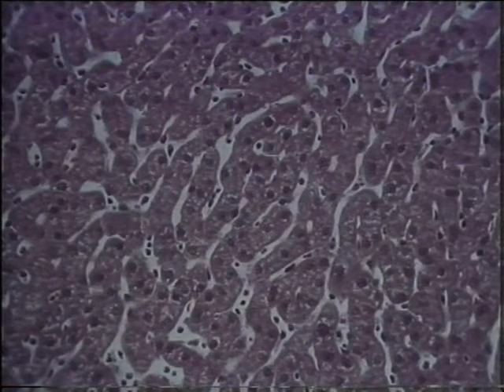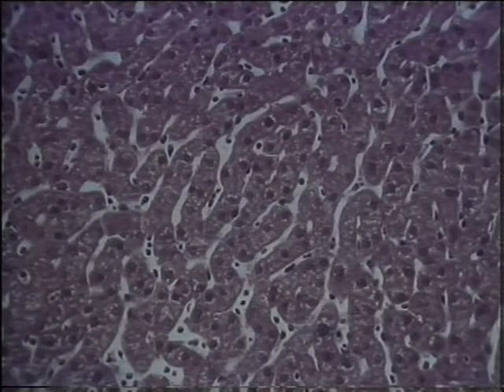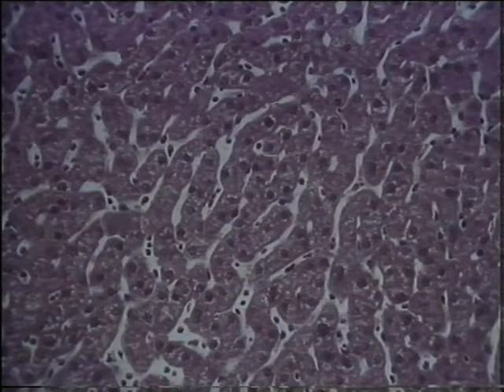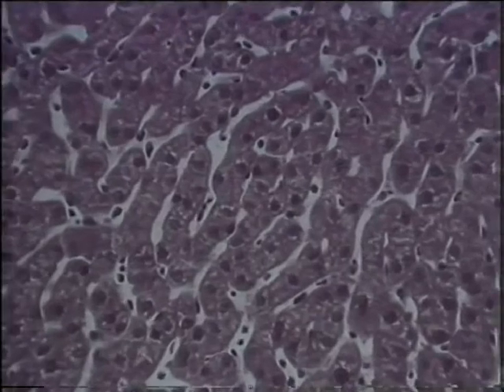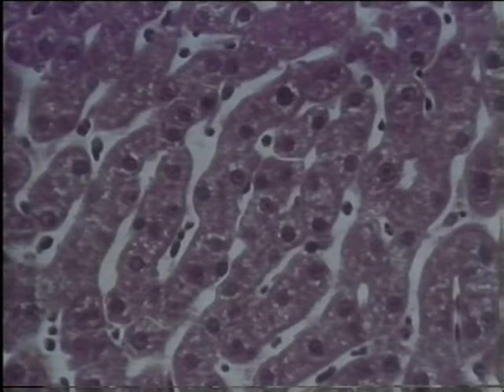All right, have a look at a section of liver. Here it's magnified about 500 times, and it's stained with eosin and hematoxylin to improve the contrast of the image. At this magnification, the image appears crisp, but the individual cells are too small to be seen clearly. You can see the nuclei, they're the dark blobs, but not much else. If the magnification is increased, so that the cells are enlarged to about 1,000 times, the image gets bigger, but you can't make out any more details.